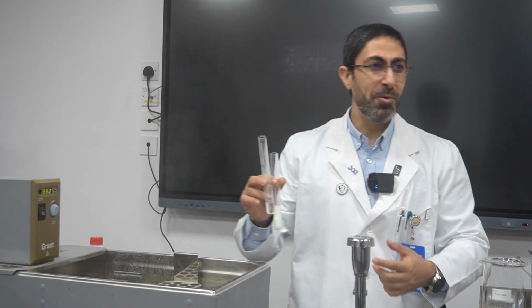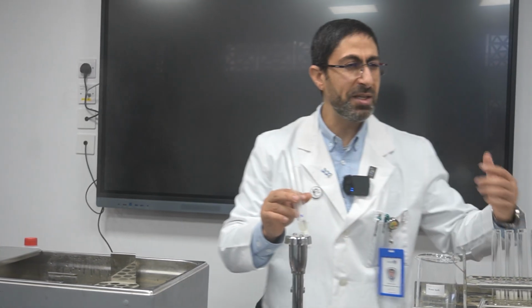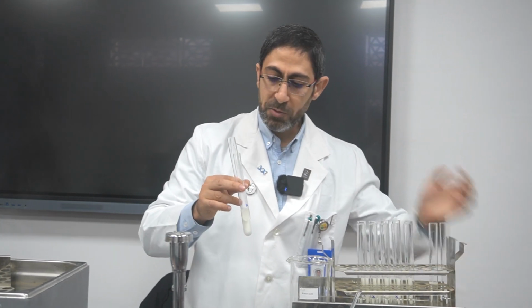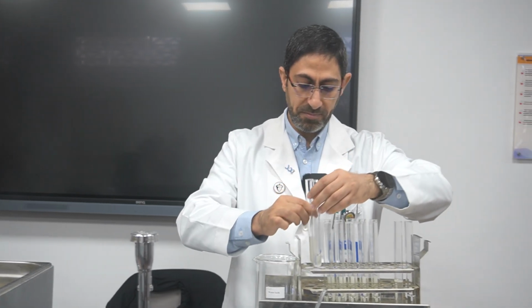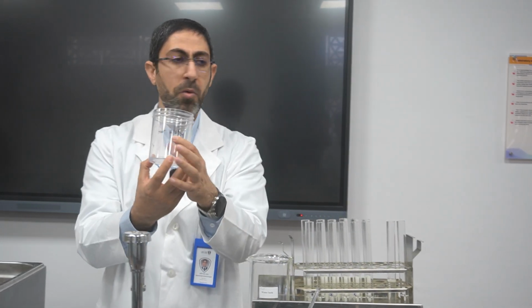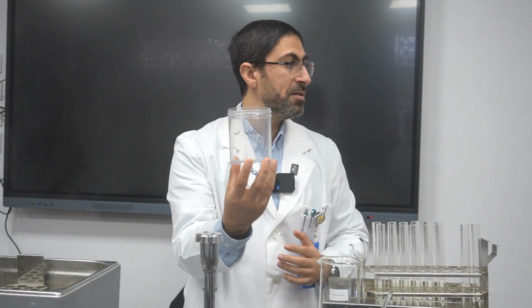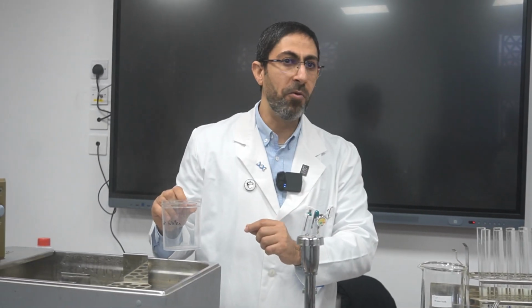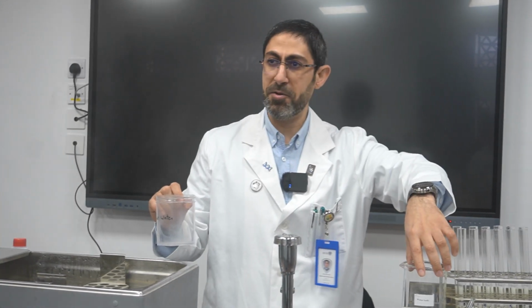How can I do this? The second option is a little bit faster in my opinion. We will do the following. Before even using the test tubes, I will use this labeled hot water beaker to take the 100 degrees C water, and I will place it in the test tubes.